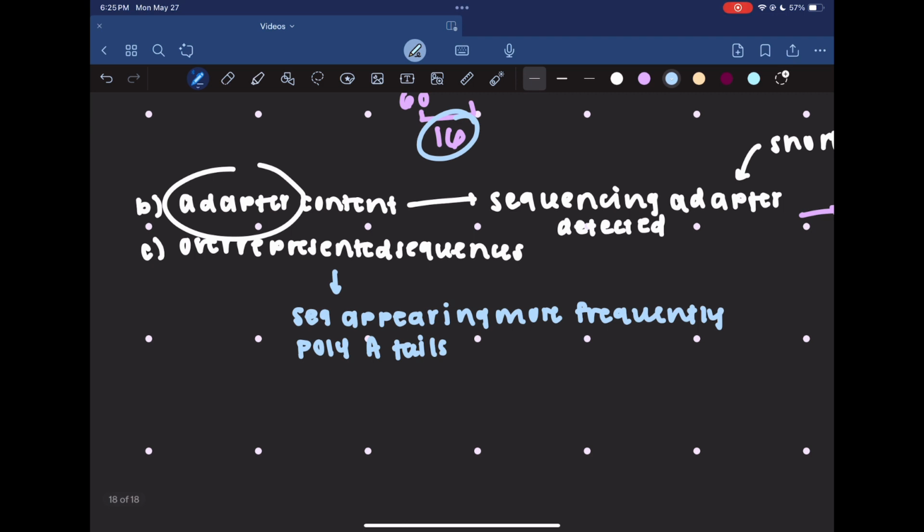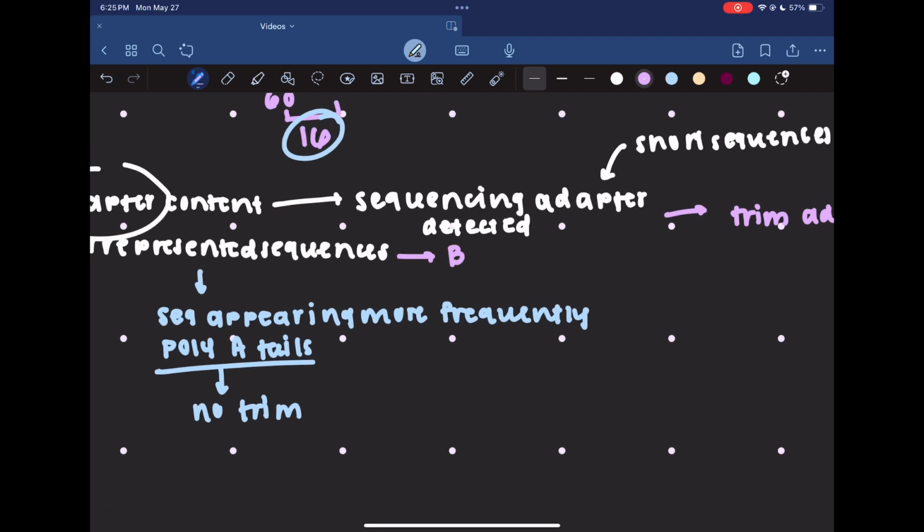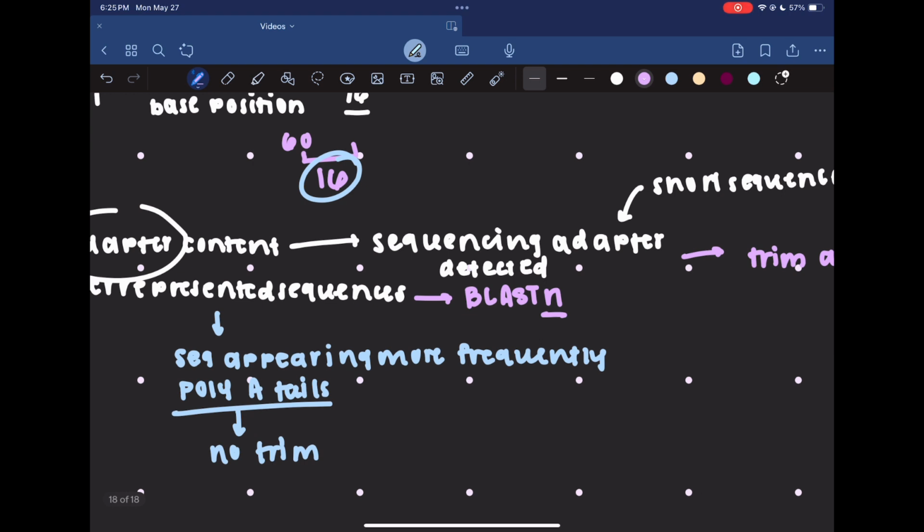I've read pretty extensively about whether or not these poly A tails need to be trimmed, and it seems like the consensus is that they do not need to be. So you don't need to necessarily trim for poly A tails, but there may be overrepresented sequences that are not due to poly A tails and are not due to primers. So the best thing that you can do in that case is a process called BLAST. And I usually use BLAST N for this, N standing for nucleotide. I'll include the links to all of the websites where you can do these things. BLAST has a very nice graphical user interface where you can just upload your sequence and you can choose a reference genome.